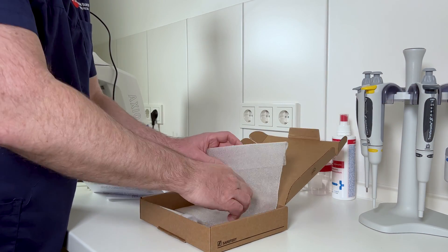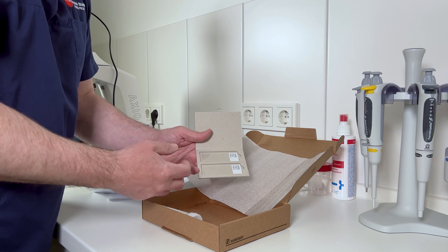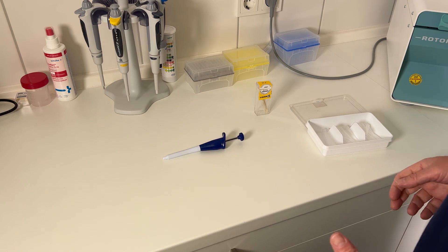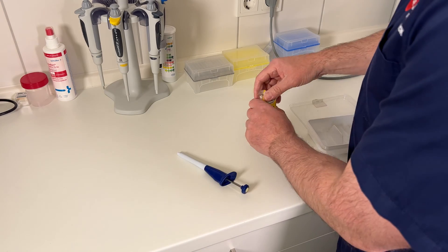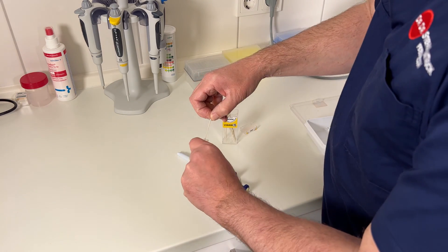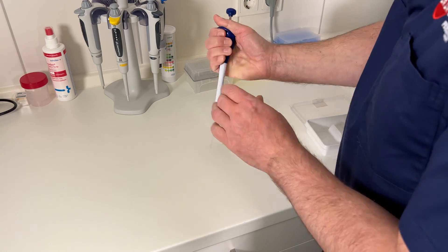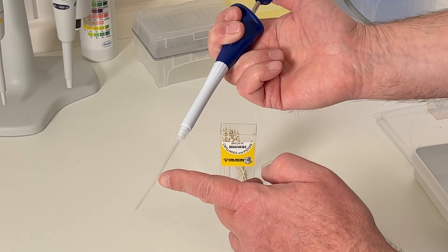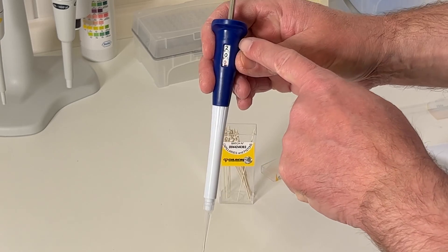Here are some slides, and I have to dye those so that I get to see the form — the morphology of the sperm. We'll do that later. I will have to use some very special equipment. This is a so-called positive displacement pipette. It works with this little one that I slide into a bigger one, and it's designed for very thick liquids. I just suck the sperm up and press it out with the inner piece to get the exact measurement and exact amount I want.